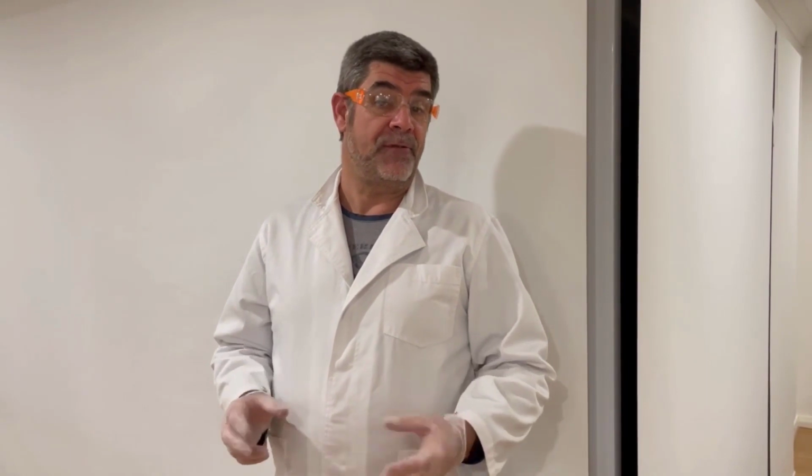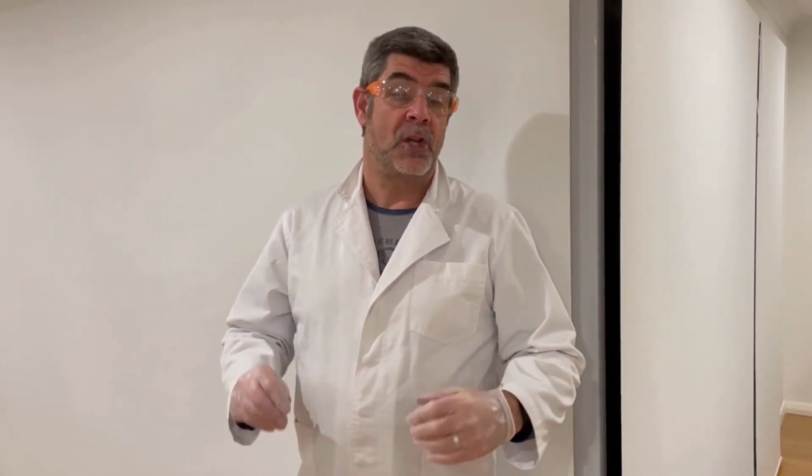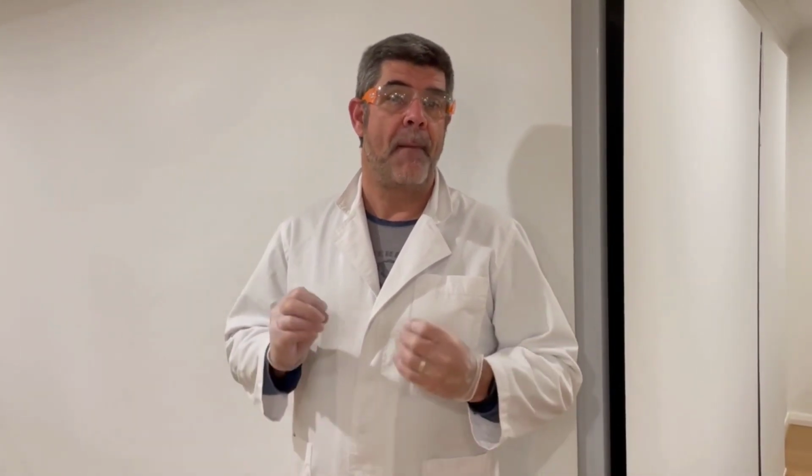And the precipitate that I identified was identifiable both from our NAGSAG rules, but also from the color of that precipitate. The fact that it was a very blue color, and also, if you remember from previous videos, that darker blue color of the copper sulfate was an indicator of the presence of water molecules. So it's very highly likely that that slightly higher mass than what we were expecting for our precipitate may be a result of water that's present in that precipitate still, without it completely drying out and the water disappearing.